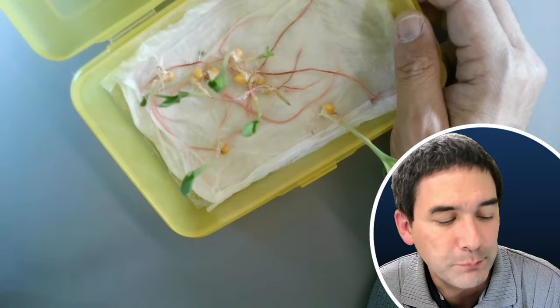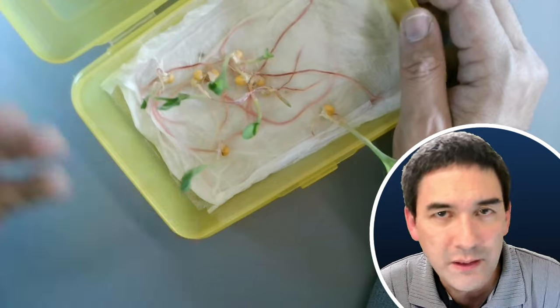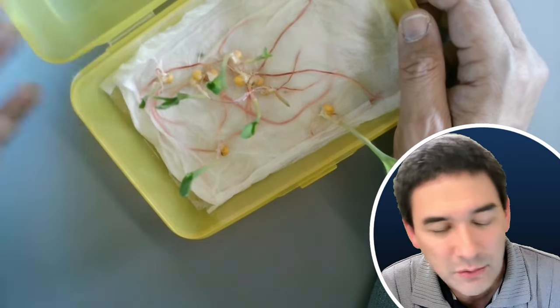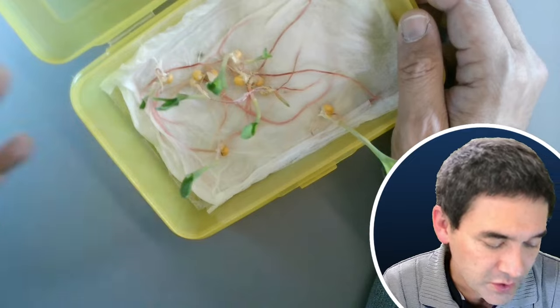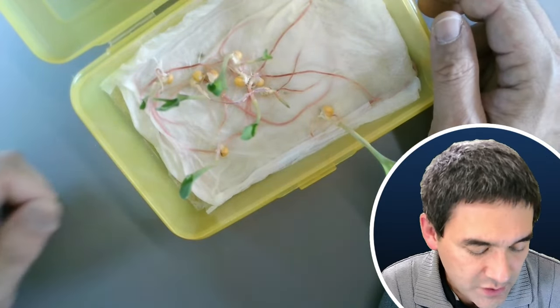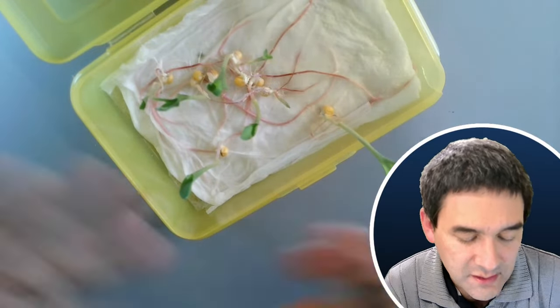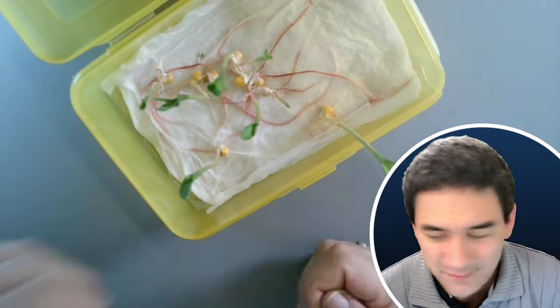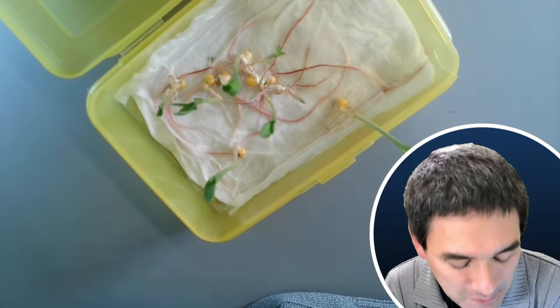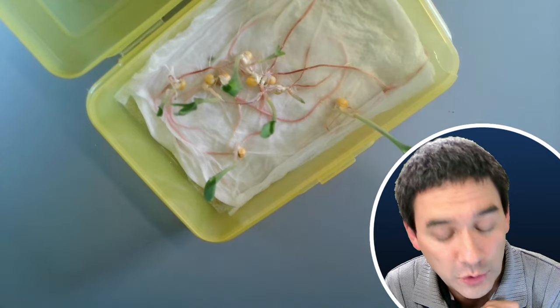It didn't work because I didn't have the right stain. I need carmine acetate — it requires very strong acetic acid and carmine. I'm in the process of preparing that. But I still want to show you how to make cells visible by crushing them rather than using a microtome, and then stain them with methylene blue.